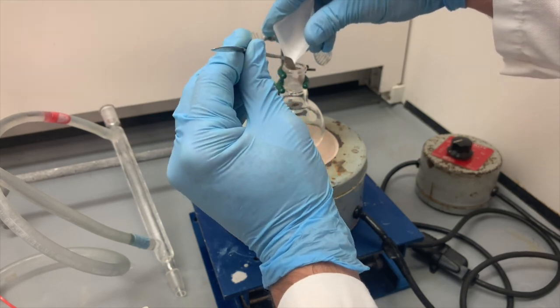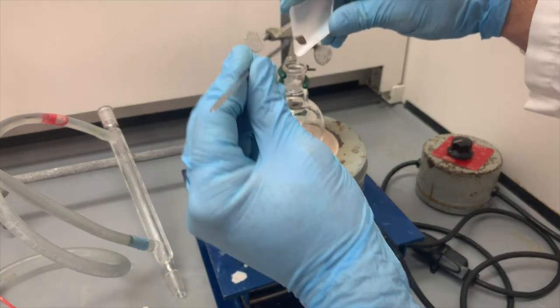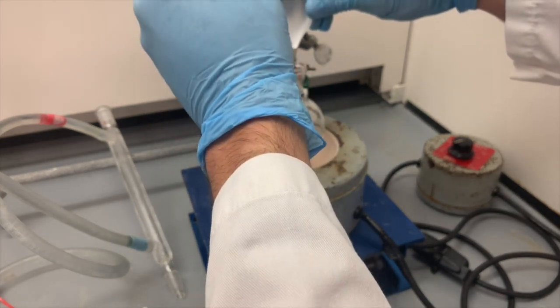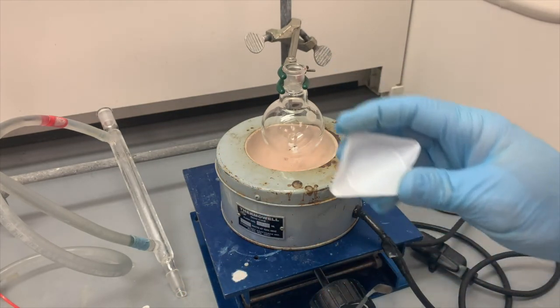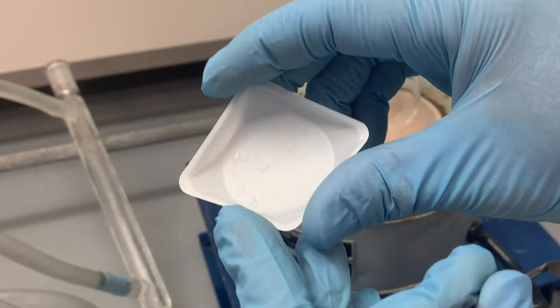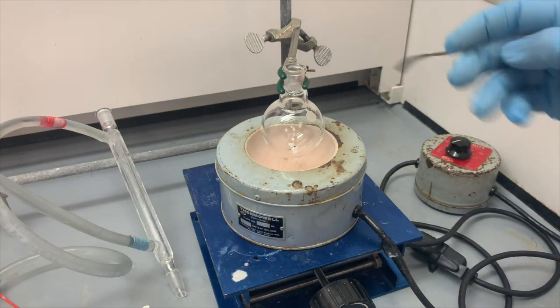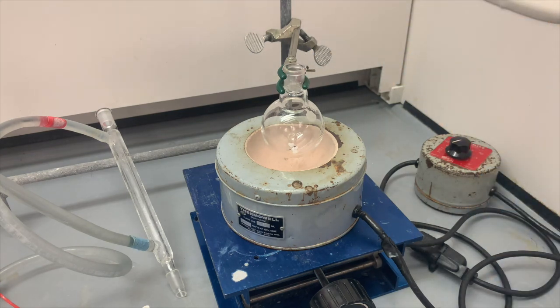So it's actually, look at that, it actually kind of stuck to the glass right there. You see that? In the process of making this video, I had to let it sit out a little bit longer than I would have liked. But there we go, it all fell down to the bottom of the flask now. If you look, there's still some liquid here. Be very careful with that liquid. That's super concentrated sodium hydroxide. So we want to set that off to the side and make sure our finger doesn't touch that. There's a little bit up here that we will rinse down when we add our ethanol solvent.